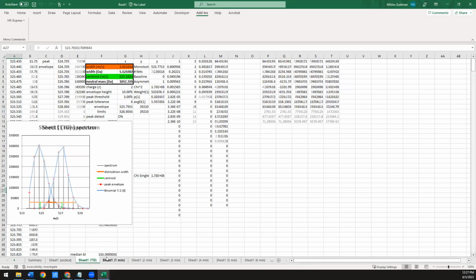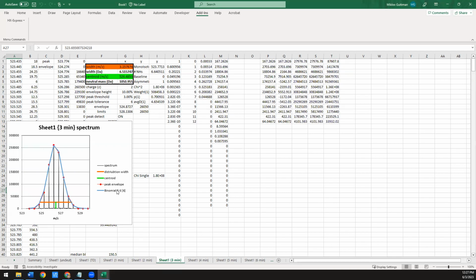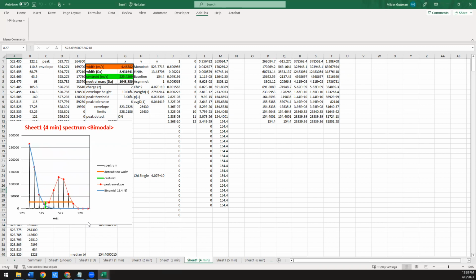So when we actually look at the deuterated data, so this was a single population, it's a nice fit, 5.5 amides. This is another great fit, 5.9 amides, another good fit, 6.6 amides. All of those are fitting so well that we have good confidence that those are just a single population that's unimodal. And then here, this was an original example where we had a synthetic mixture that was a 50-50 mixture of undeuterated and fully deuterated. It fit well to one of them, but it ignored the other. And it's also flagging it because it's indicating that something about this looks weird and might be bimodal.